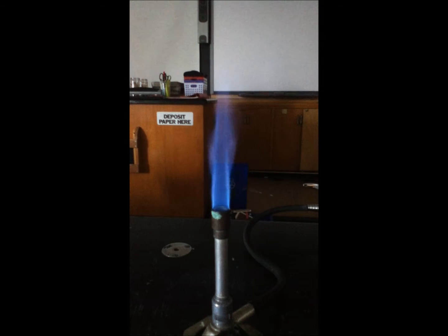We'll probably have to do it a few times just to see what happens. Putting the solution in the loop, you can kind of see we've got a light violet sort of color being produced on the right-hand side. I'm going to put the loop on the right-hand side of the flame, and you can kind of see a little bit of light purple color.